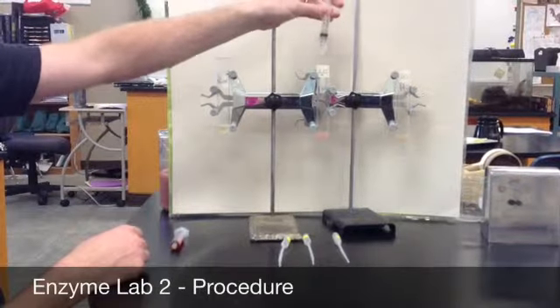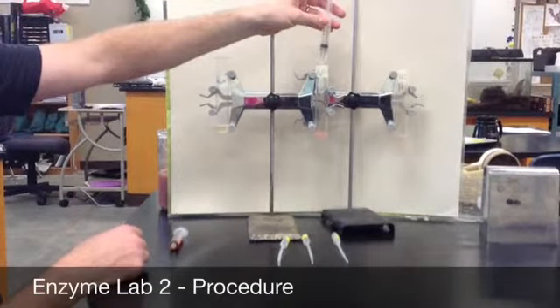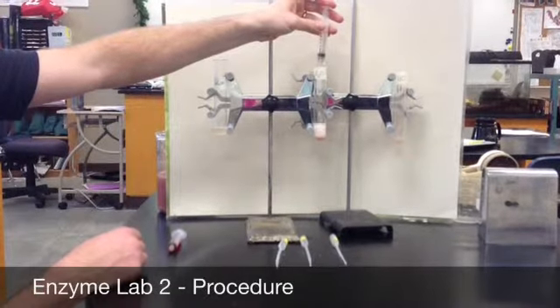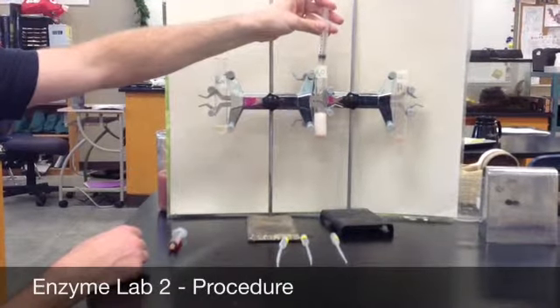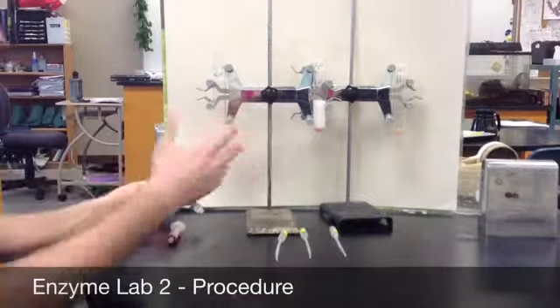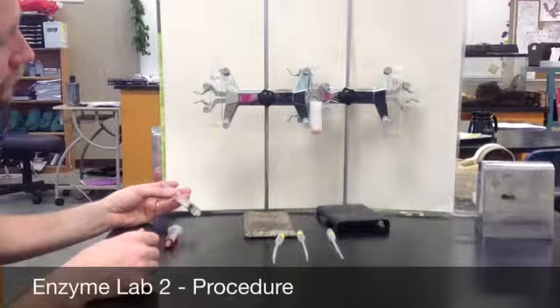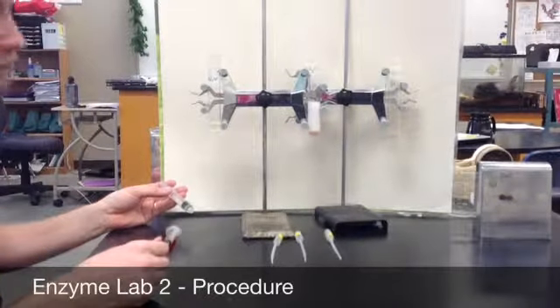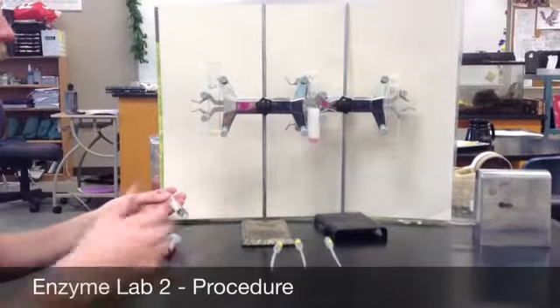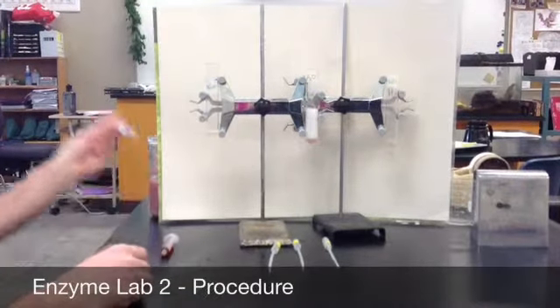When we add 2 milliliters to the neutral solution, the one with water, we'll find that that reaction takes place fairly quickly. You'll see the bubbles are rising up almost halfway up the tube. So that should be fairly similar to the reaction that we saw with our baseline reaction rate of 5.